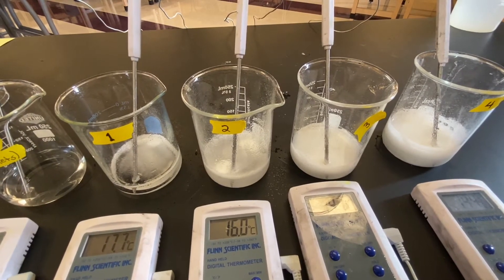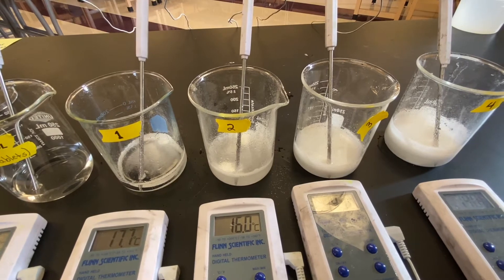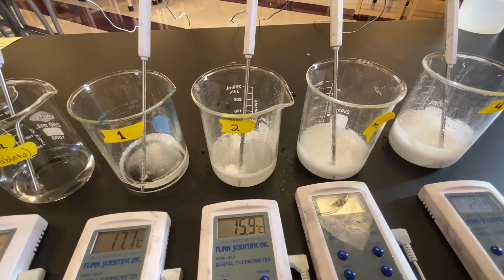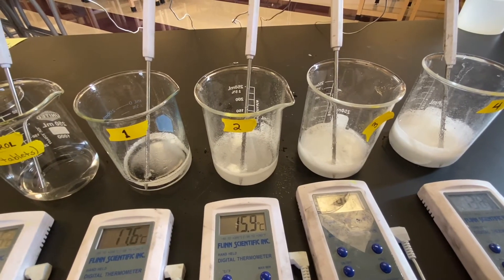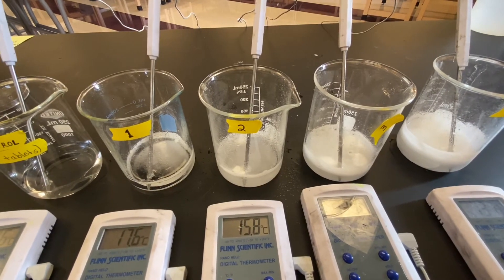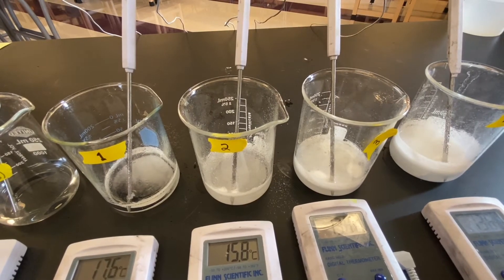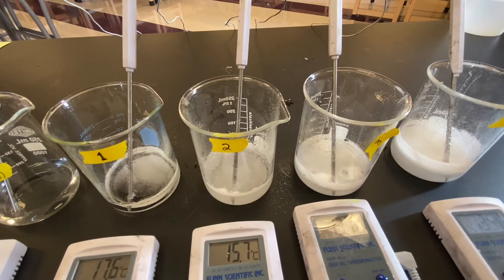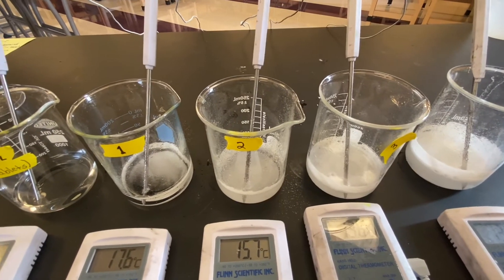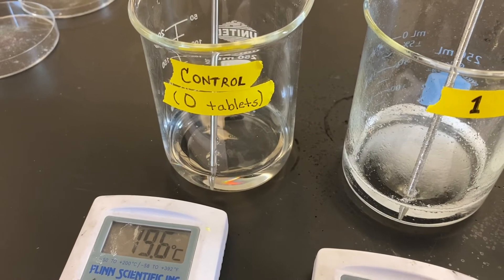As we're doing this, we're not only writing down quantitative observations, but we're taking mental note of qualitative observations as well. You hear a bubbling noise or a fizzing sound, kind of crackling. As this chemical reaction takes place, we see a little bit of color change — not much. It's just kind of getting gray and foggy or white in there. It's unclear whether the water is actually changing color or if there are just so many bubbles it's appearing foamy and white. And there's the control — just water sitting there, temperature hasn't changed much.